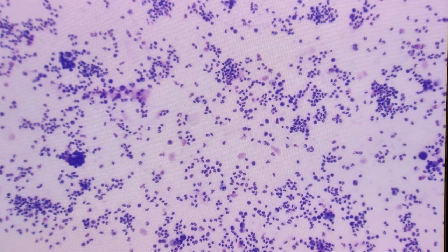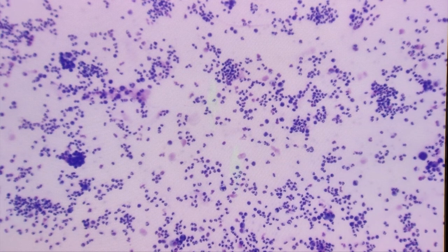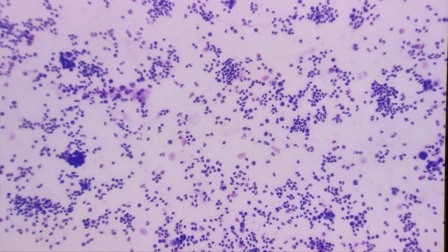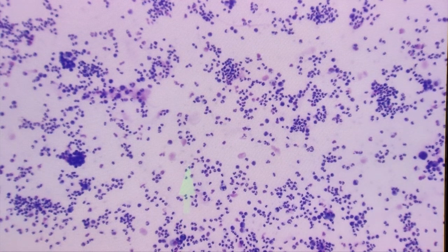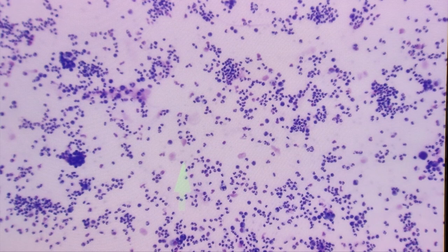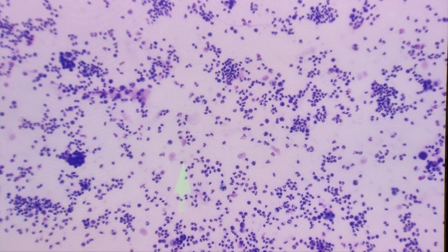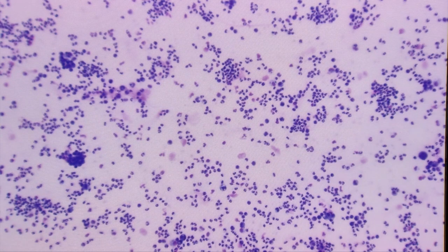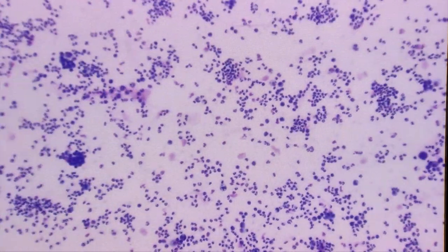Another thing we can look for at lower power is erythrocytes — they're kind of faint at this power. There is an erythrocyte there, so there are very low numbers of erythrocytes in this sample. Now I'm going to move up to the 40x objective.